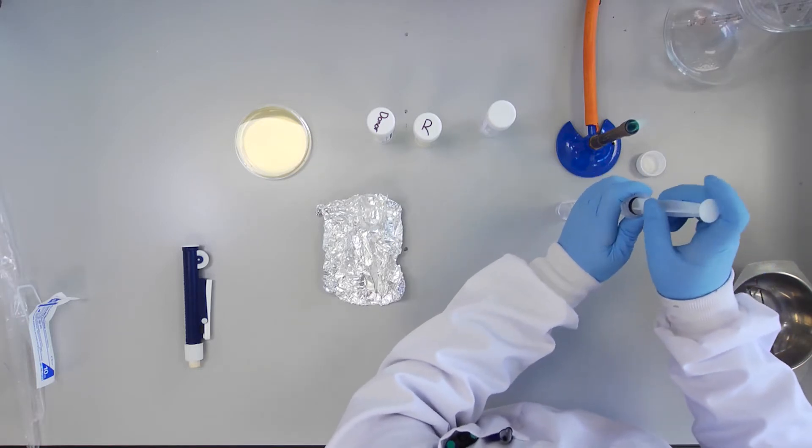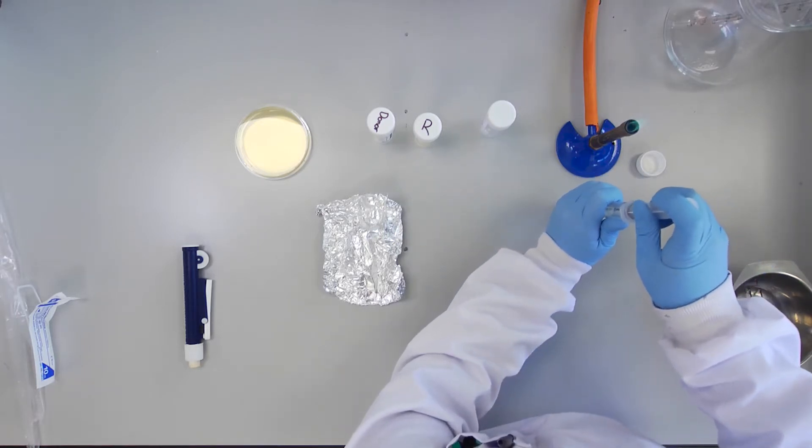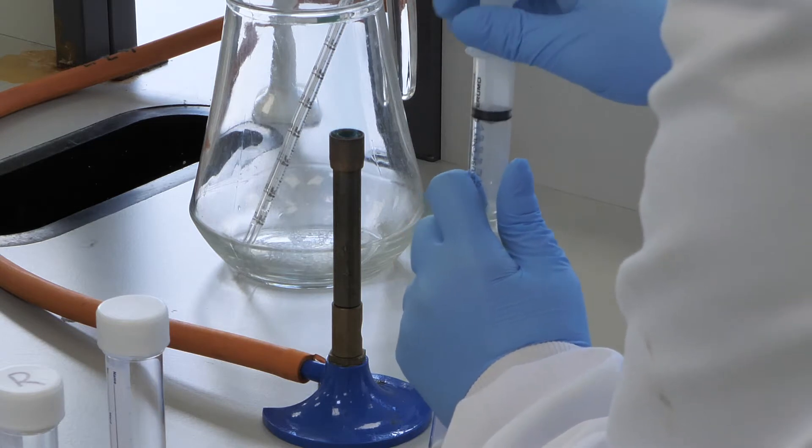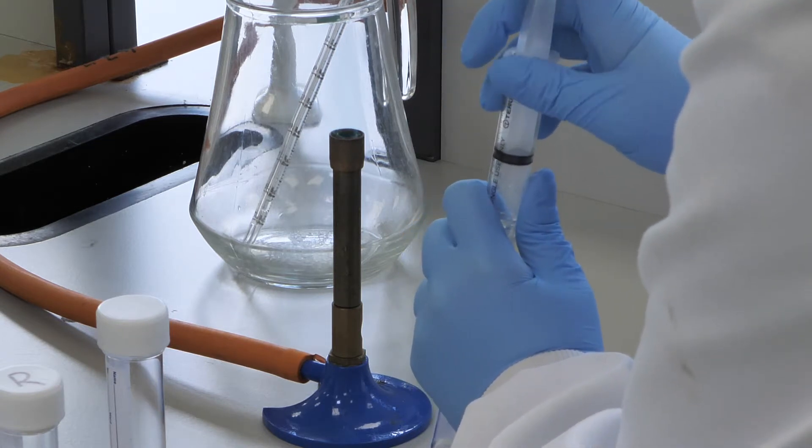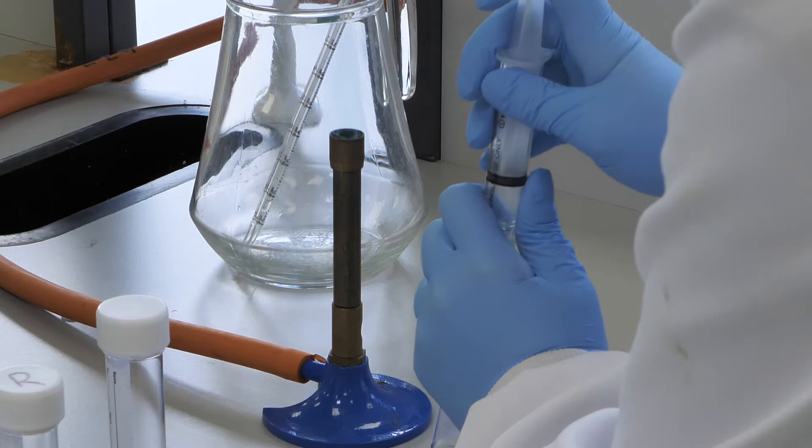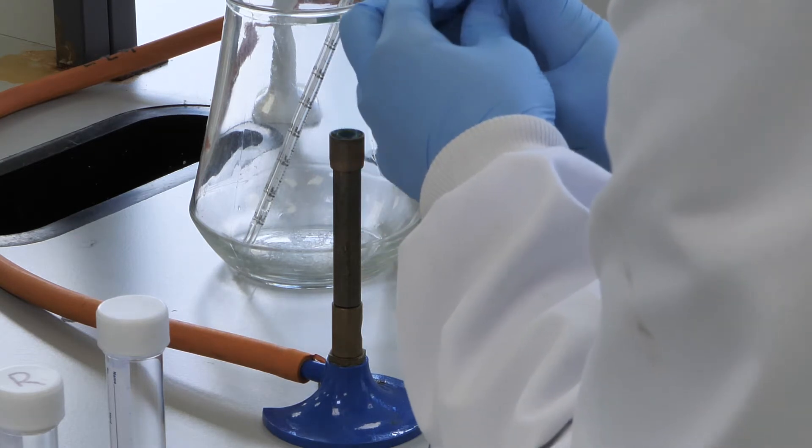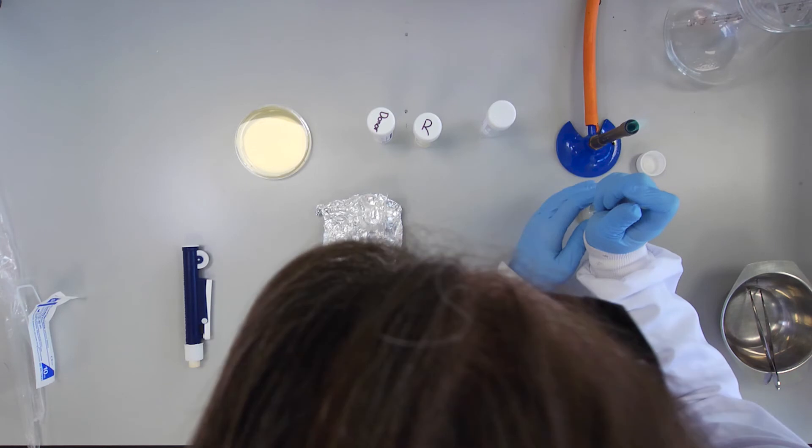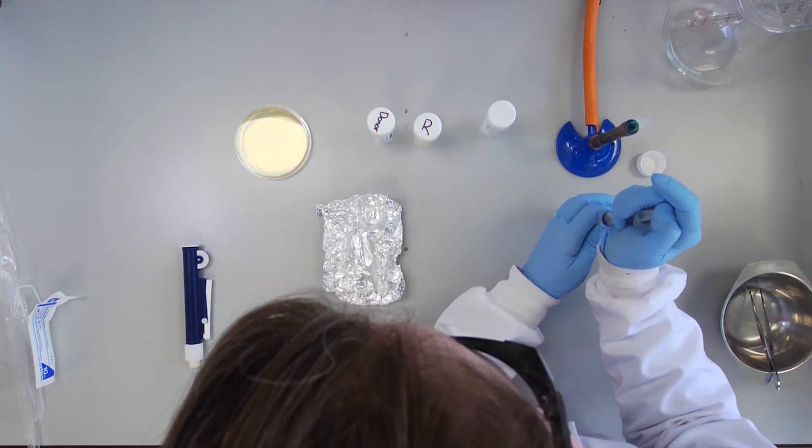Holding the universal Swinex syringe setup securely, push down on the plunger. You must maintain pressure on the plunger until all of the culture has passed through the filter.